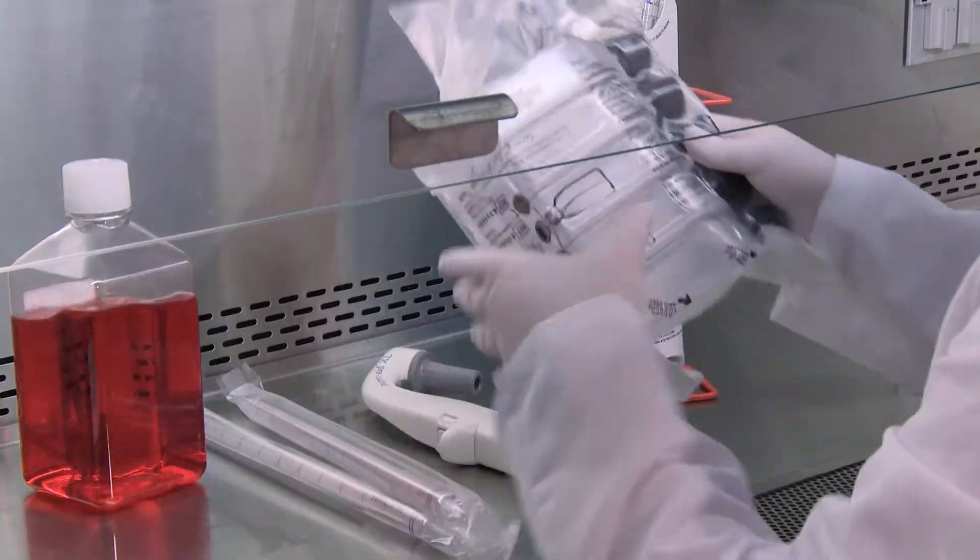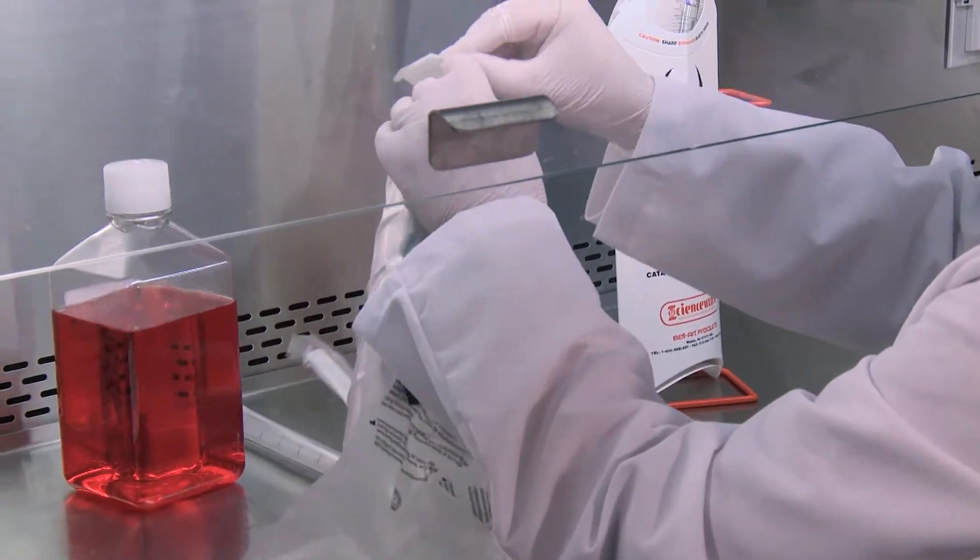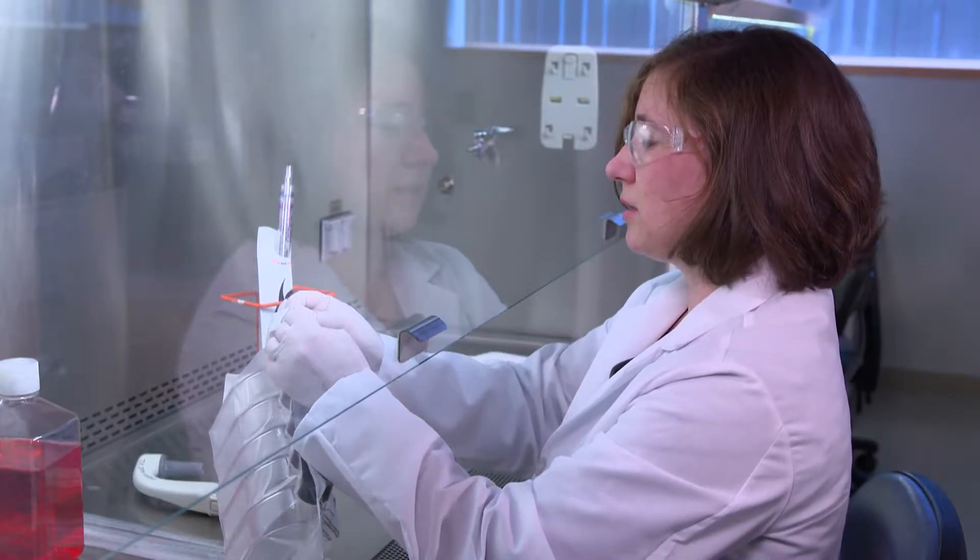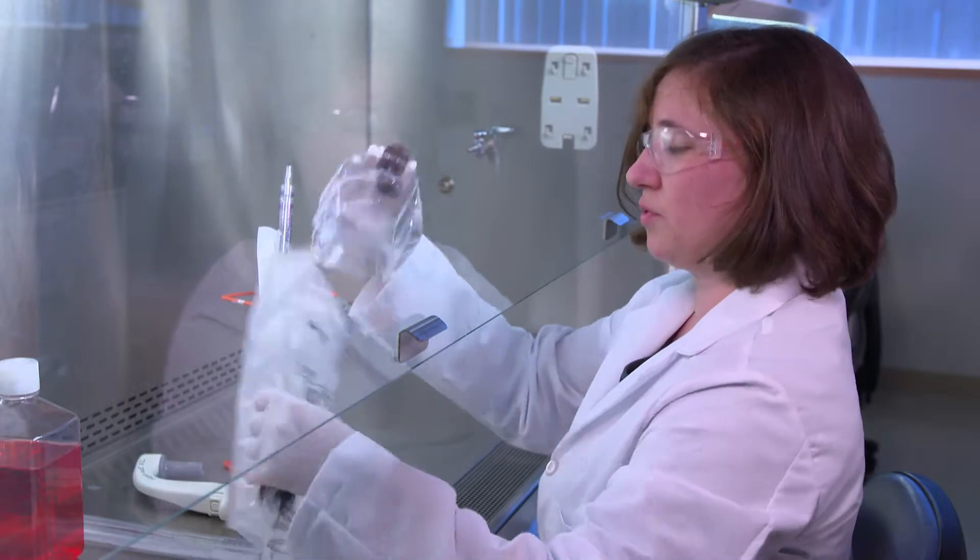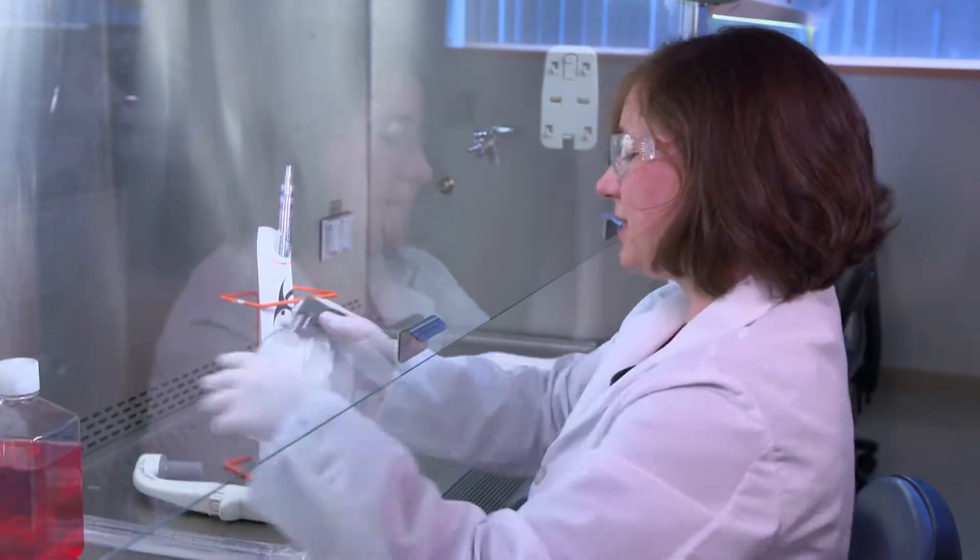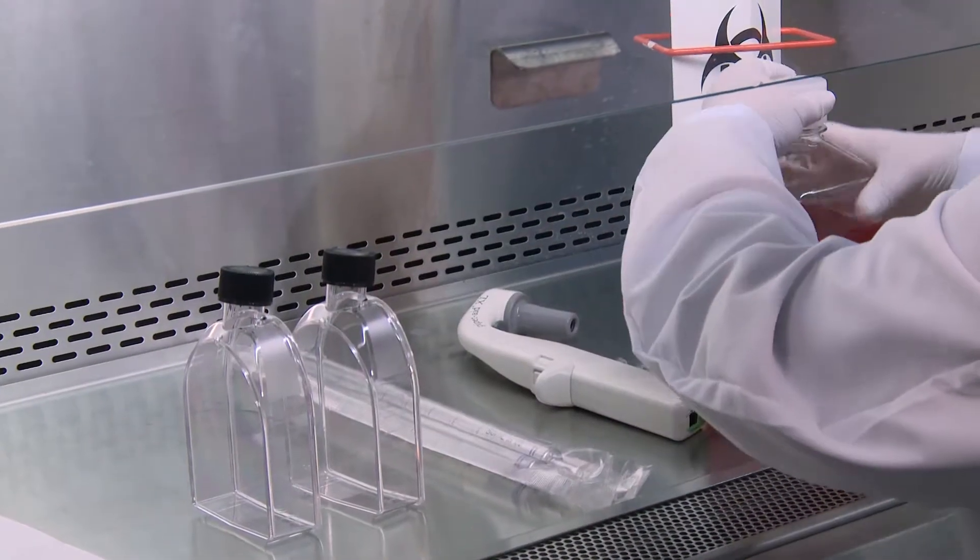Any spills that occur will be wiped off immediately with the wipers. You remove the items as you need them, and anything else leaves the biosafety cabinet if it's not needed.